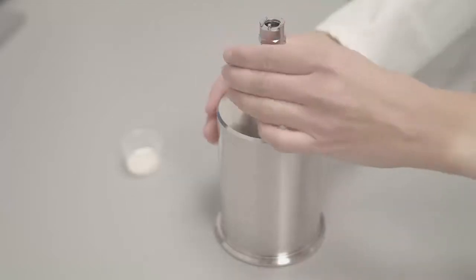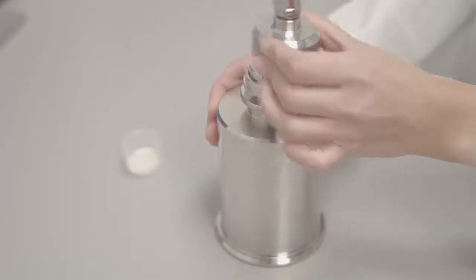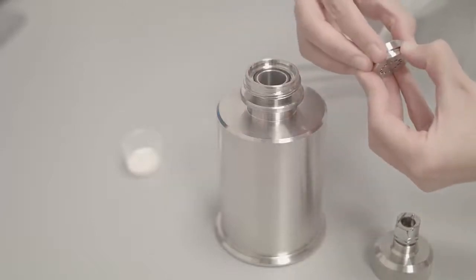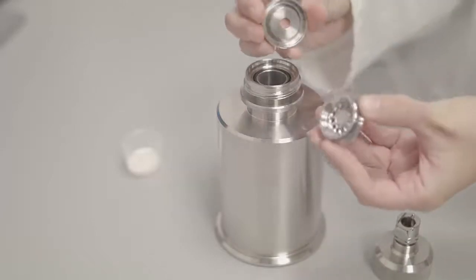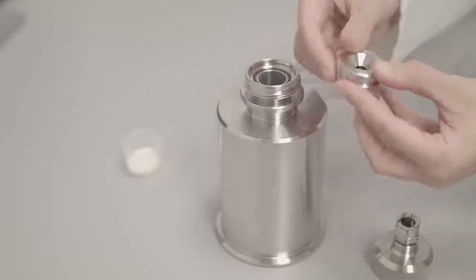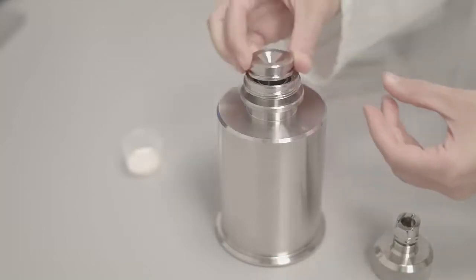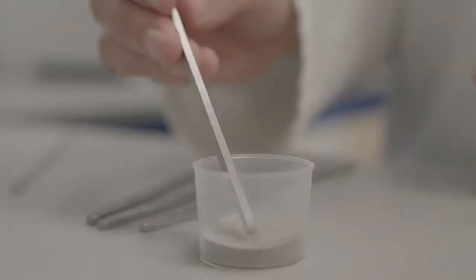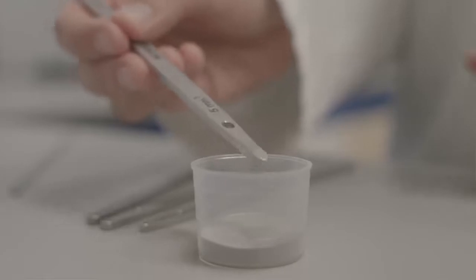Looking at the sample dispersion unit in more detail, the SDU contains a dispersion spool into which sample is loaded. When compressed air is applied, the sample will undergo shear forces through the smaller holes and be dispersed into the chamber below. Controlled sample amounts are loaded into the SDU spool with volumetric spoons.